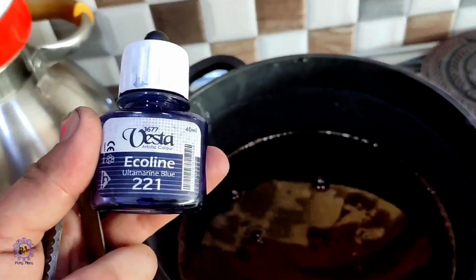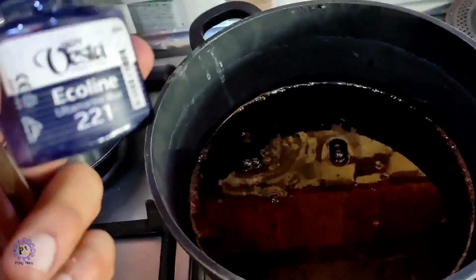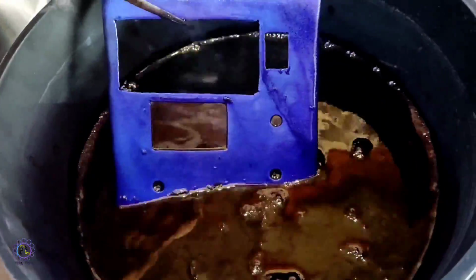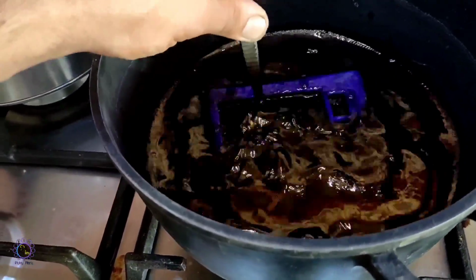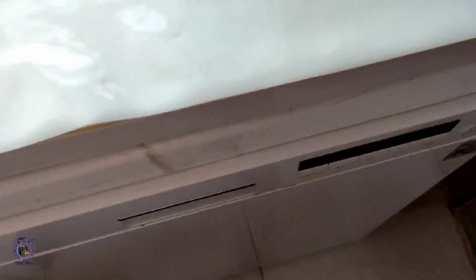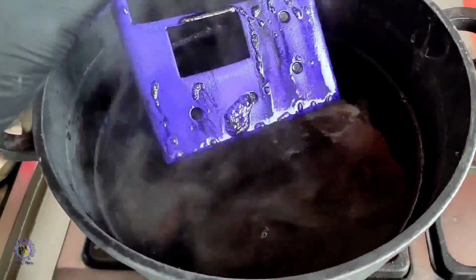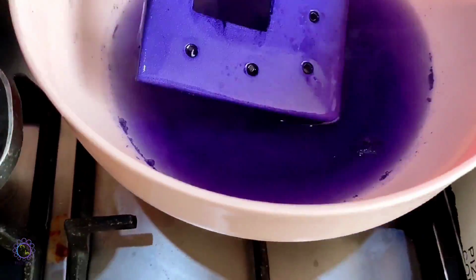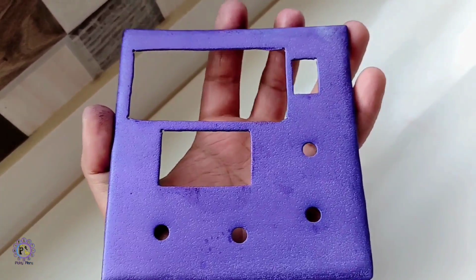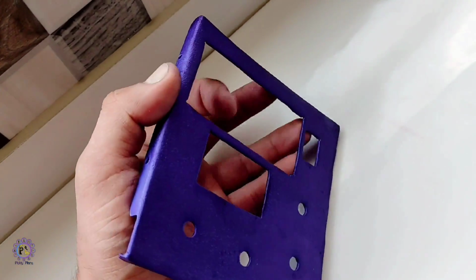When anodizing was done, I added some water soluble ink to the water plus some crystal violet dye, which is used for gram staining of bacteria, to give the desired purple hint. And afterwards it was sealed in the nickel salt solution. And here is the final result after anodizing coloring. Very nice, I like it.